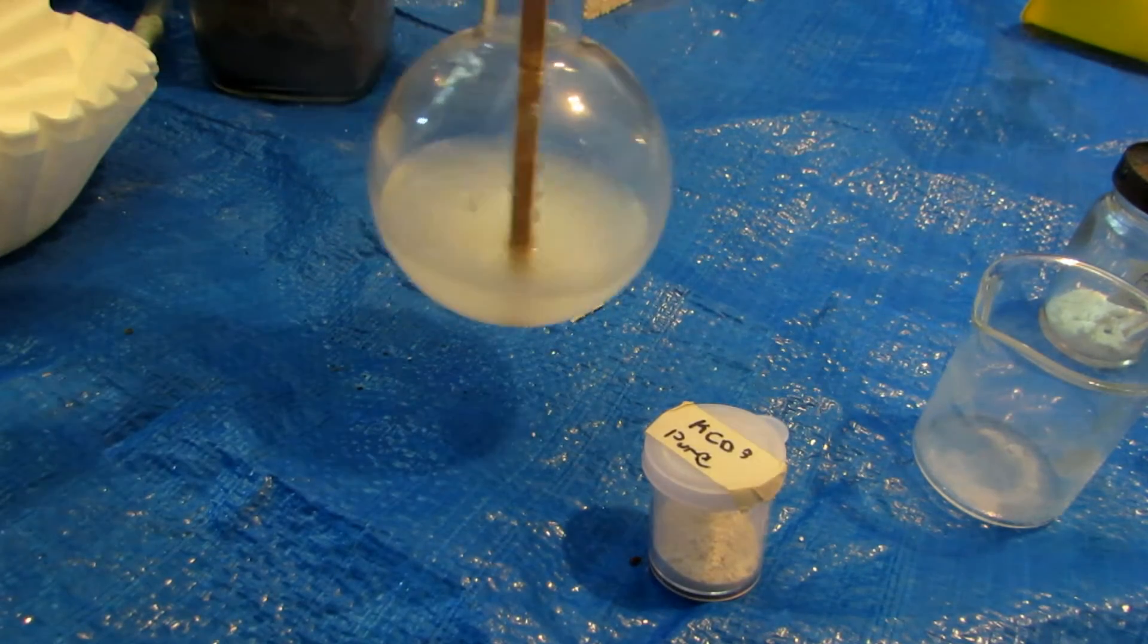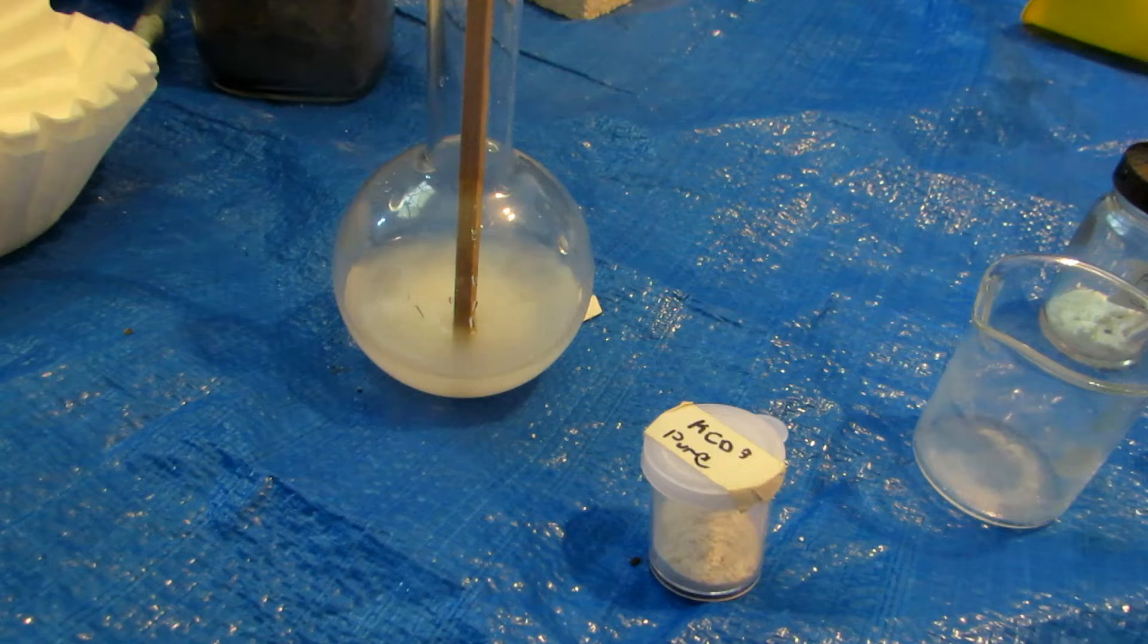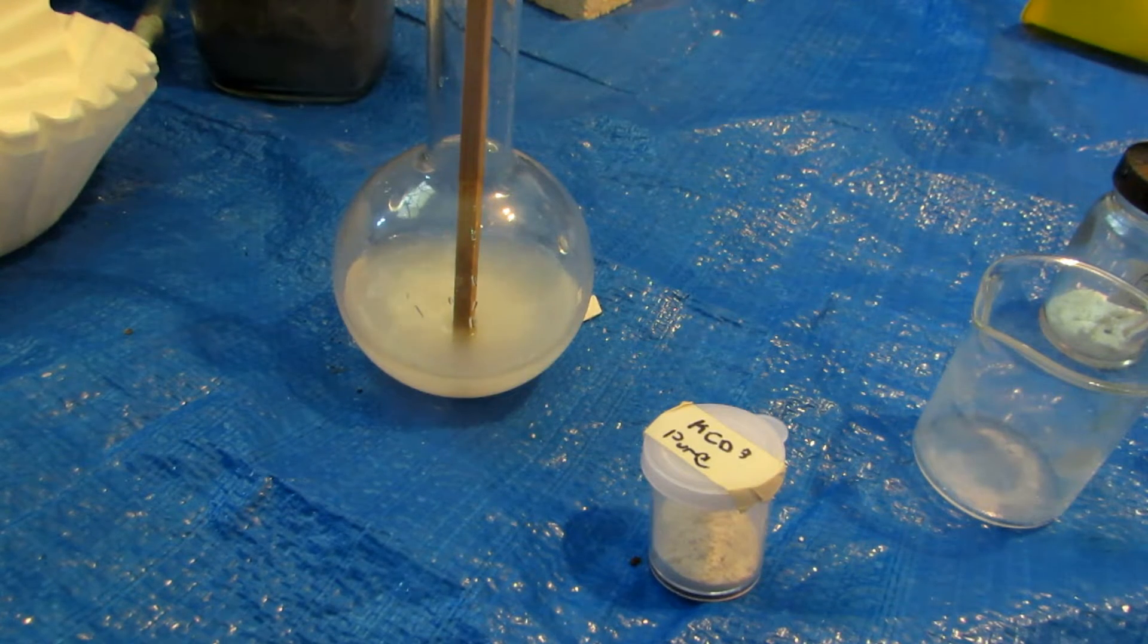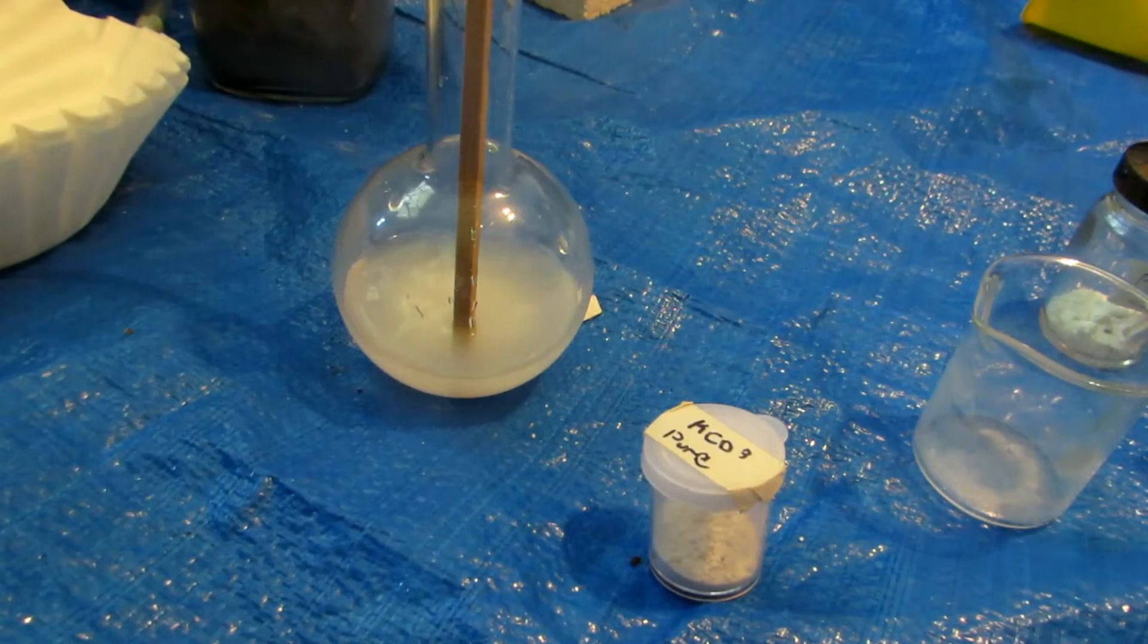So that's okay because we'll try this out. I also might add a bit more water just to get more of the stuff to dissolve, but if it doesn't, that's fine. Anyhow, so we'll take a coffee filter, put it in our funnel, and filter it off.